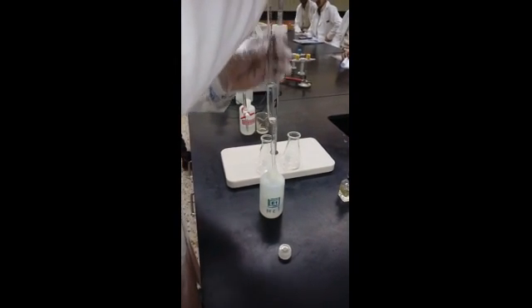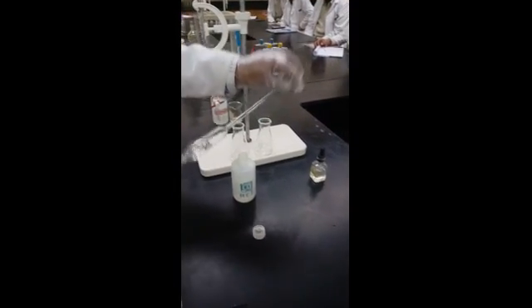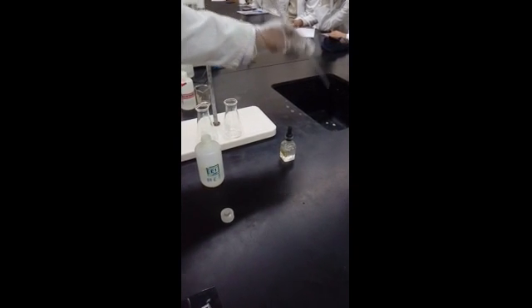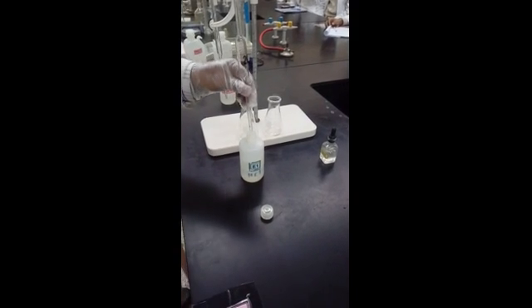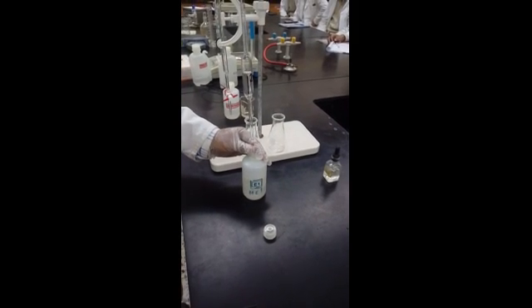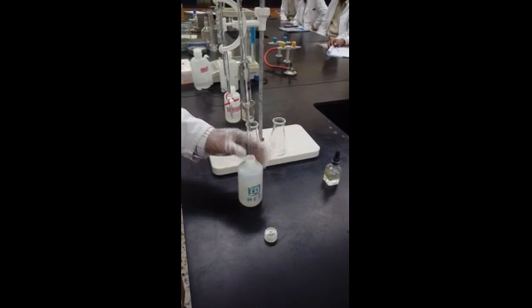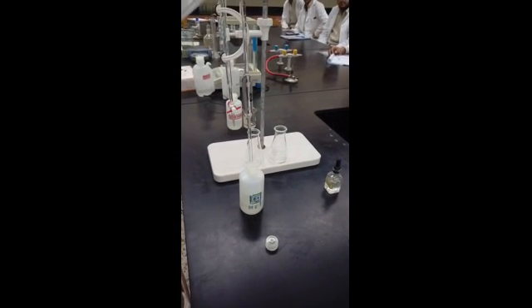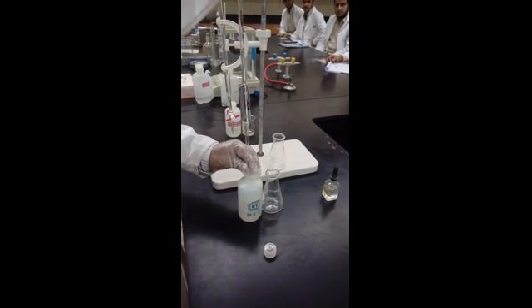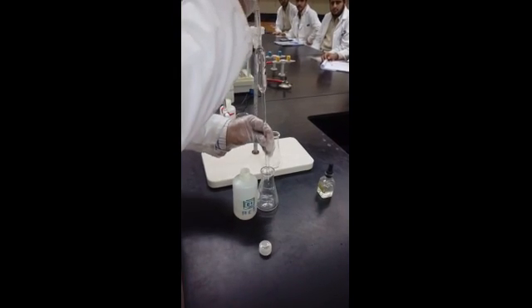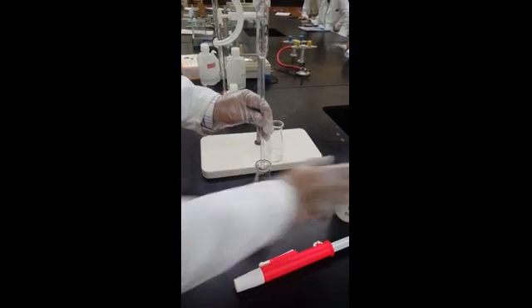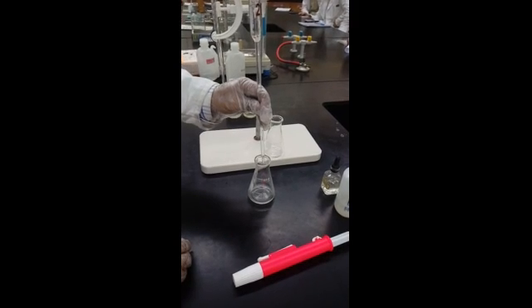Take the acid. We take a little bit of the acid solution normally. And then what we have to do? We have to rinse it and then throw that solution. Don't take it. Go back and pipette inside the solution, unknown acid. How much? Up to 20 milliliter mark. So you can see the volumetric pipette. The mark is here. In this place. So this is 20 milliliter. Up to this point. So keep your conical flask nearby.